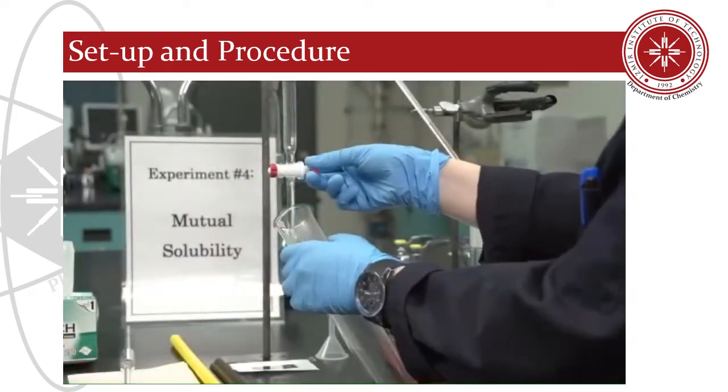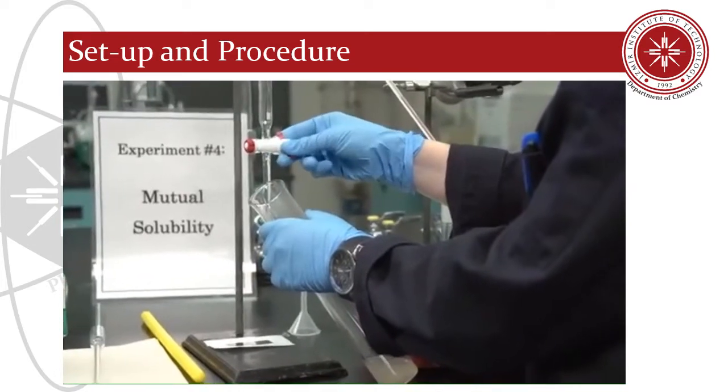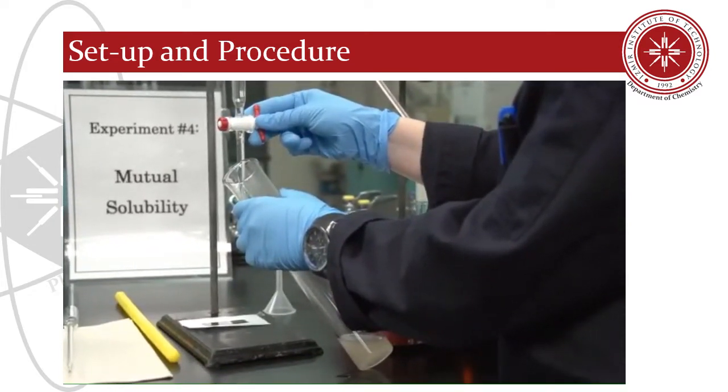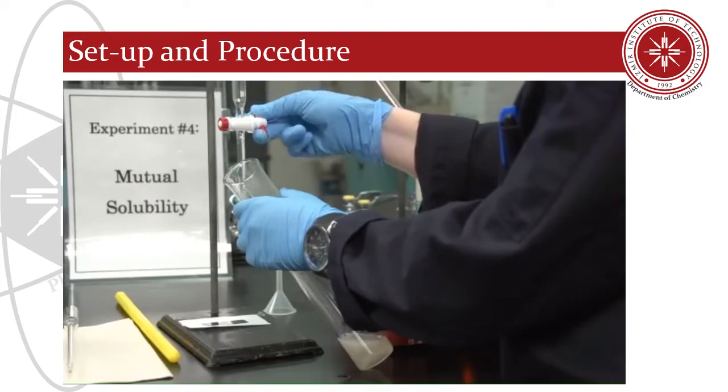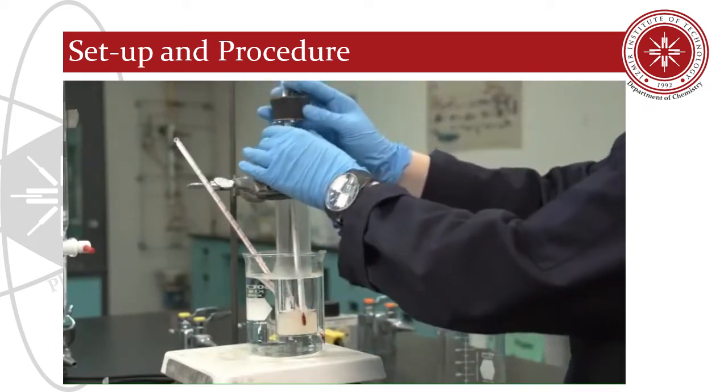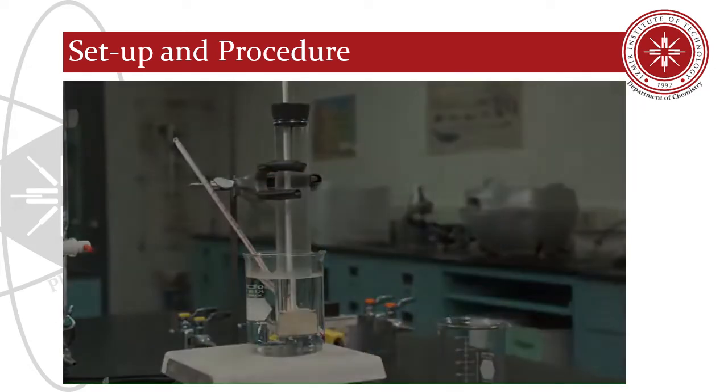From the burette, add 3 ml of distilled water to the freezing tube. Remember to record the volume of water added to 2 decimal places as read off the burette. Heat and cool the mixture again to determine the cloudy to clear and the clear to cloudy temperatures.